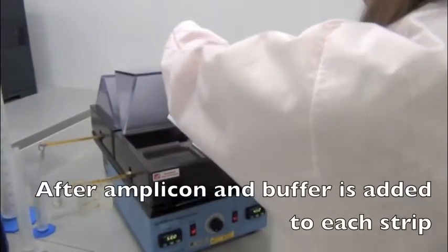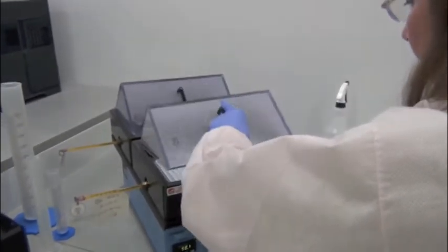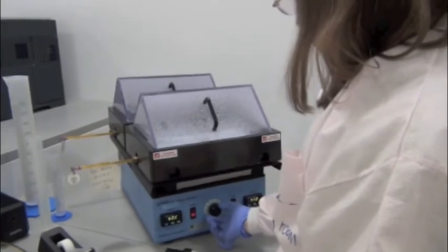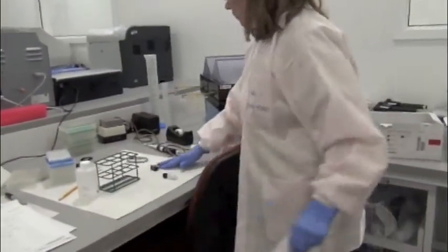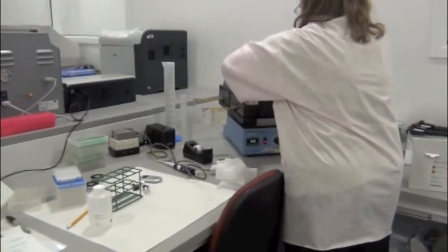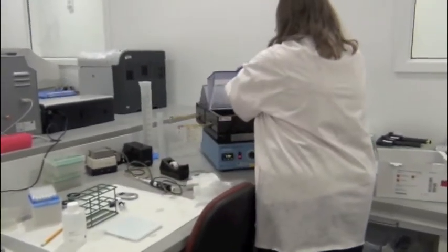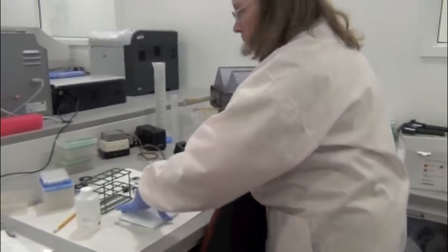So they're being incubated now? Incubating in a water bath. It's a 50-degree rocking water bath. So it's going to gently rock those back and forth for 1 hour. First I'm going to turn it off so they're not rocking anymore. Take these out and just set them down here to break the water. That's just DI water in the water bath.